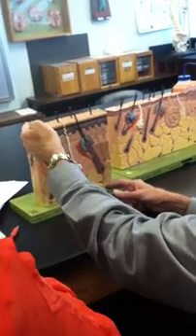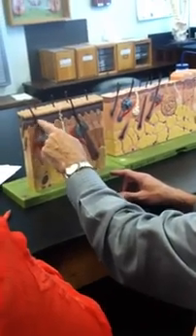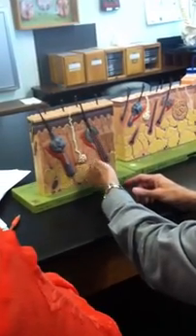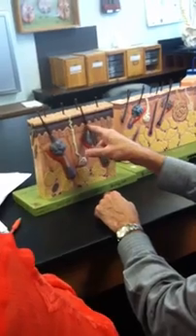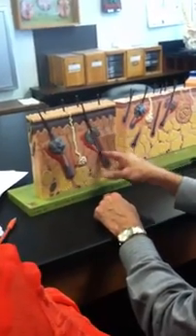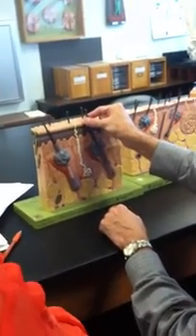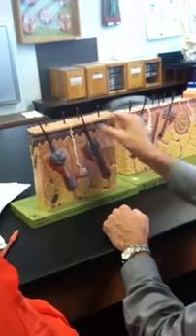Above the epidermal surface is the hair shaft. Hair root is what's below the surface, you see here. This is a longitudinally sectioned follicle. You see the hair root within the follicle itself, always dark brown. In the center of the follicle is hair root. Still hair root, then it leaves the surface, now hair shaft.